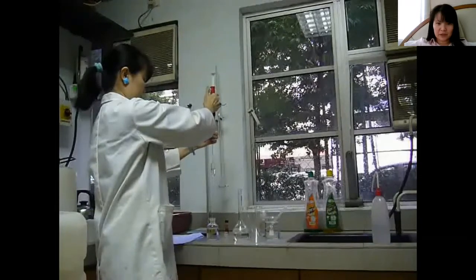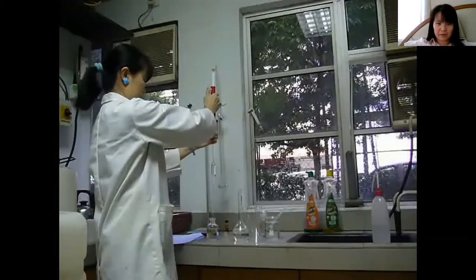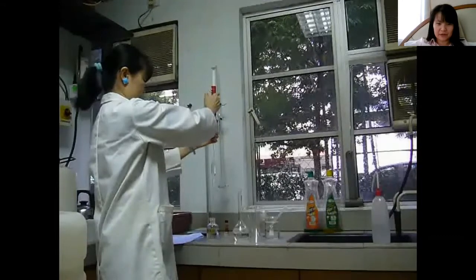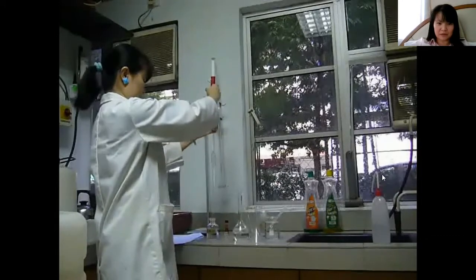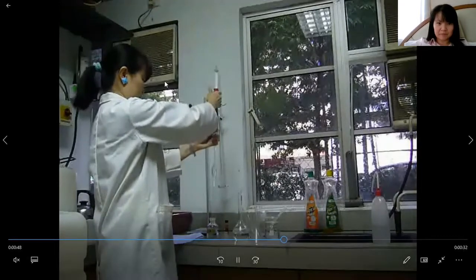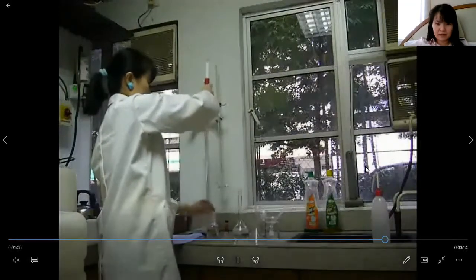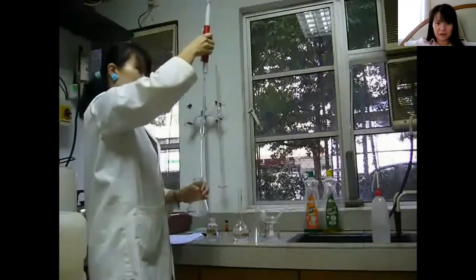So it has to reach the fine mark on the pipette that says 25 centimeter cubes or milliliters. And then put it into the conical flask.